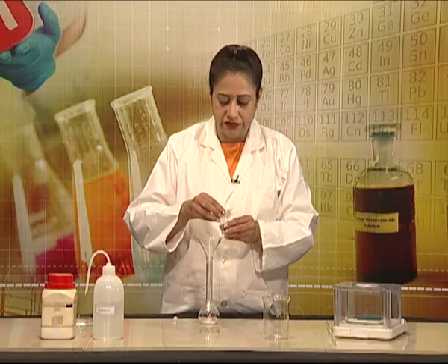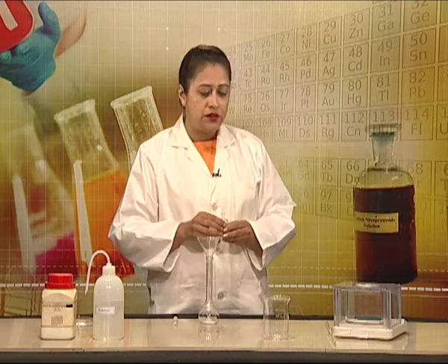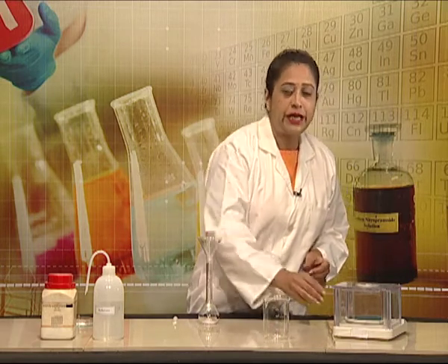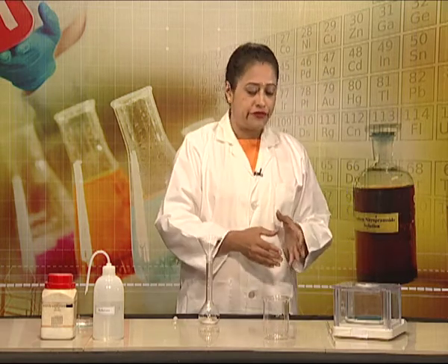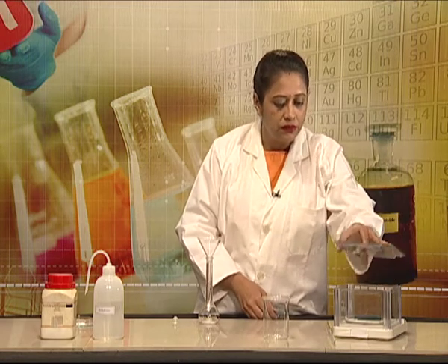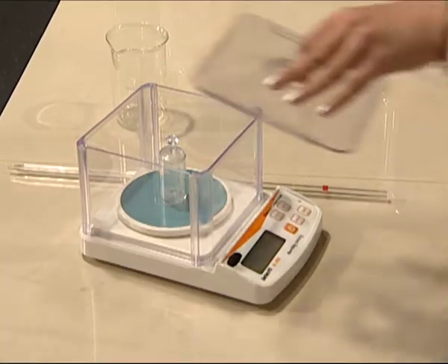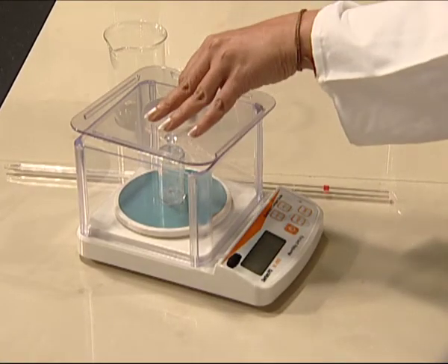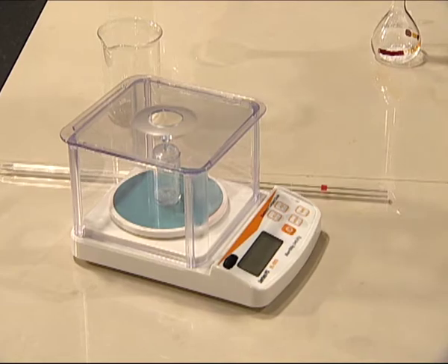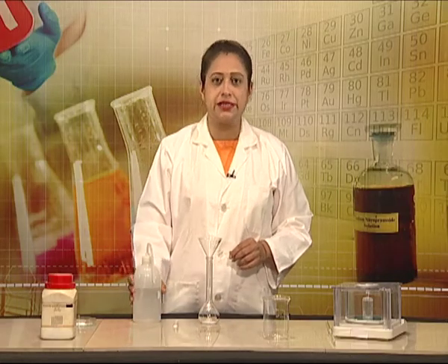Salt may or may not get completely transferred, which is why we will need to take another reading of the weighing bottle after transferring the salt. In the meantime, we first prepare our standard solution.